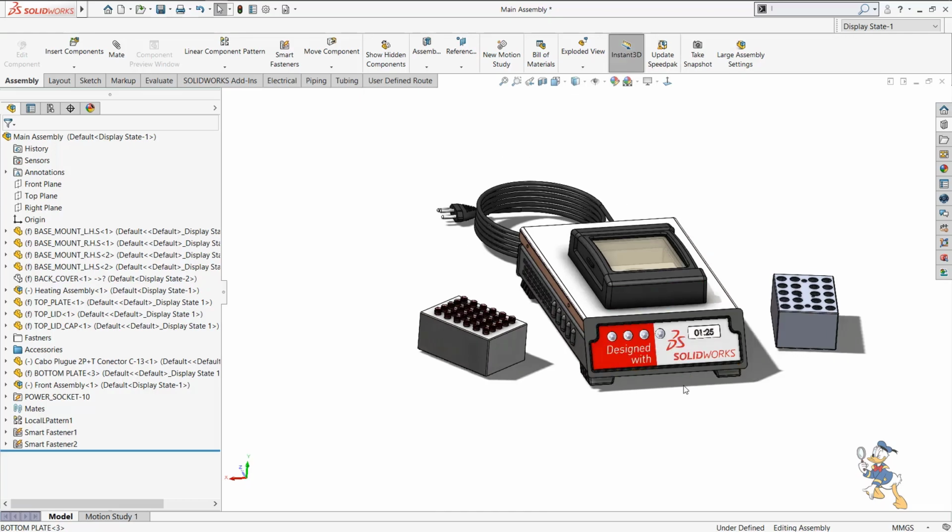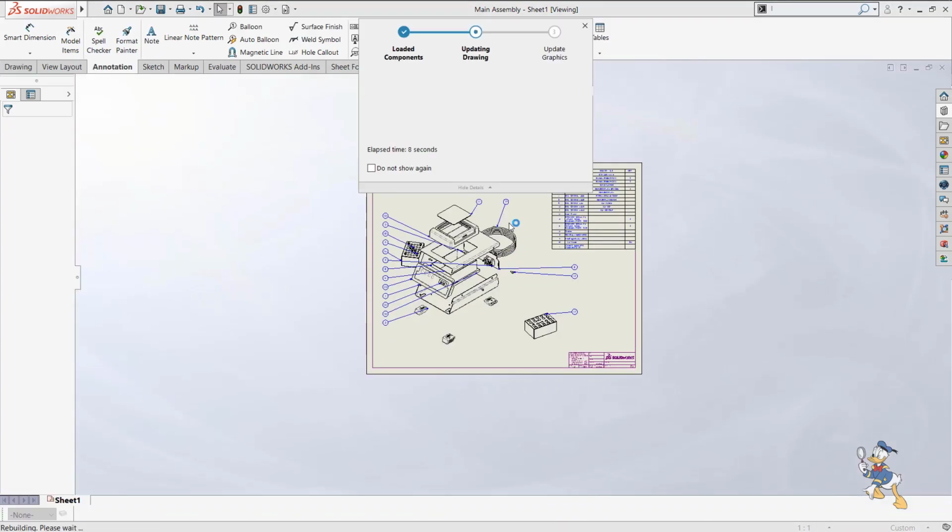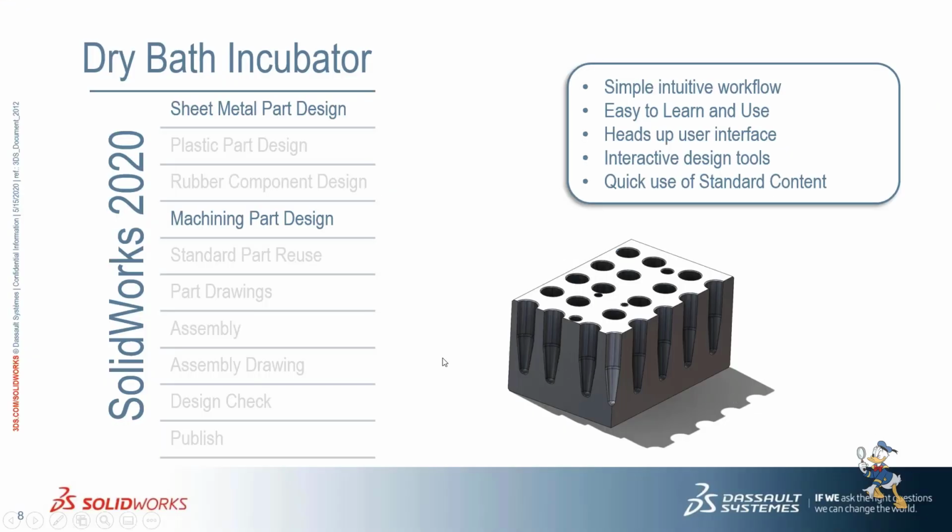So this is how we can design in SolidWorks. And suppose if we need to draw an assembly drawing for this assembly, we can do this as well. I just need to make things happen for the assembly, and let's see how the assembly drawing is going to happen. So this is how we have previously generated the assembly drawing for this assembly, and there are some balloons generated for this assembly, some bill of materials also generated. This kind of facility is available in SolidWorks.